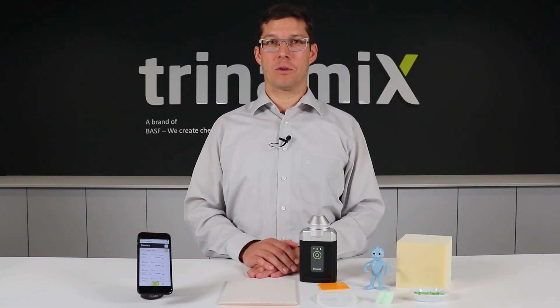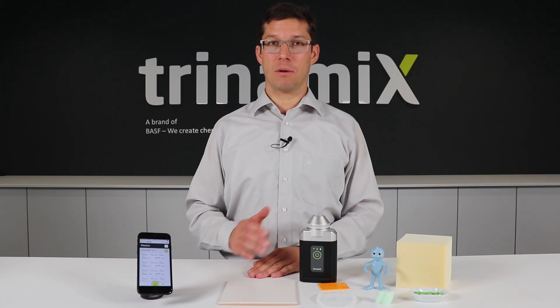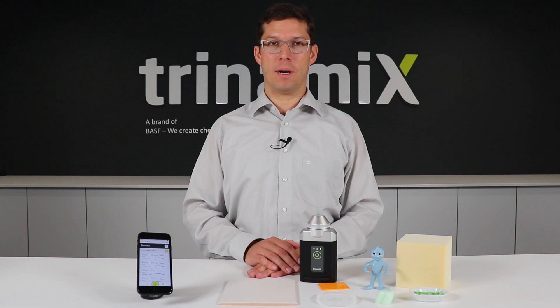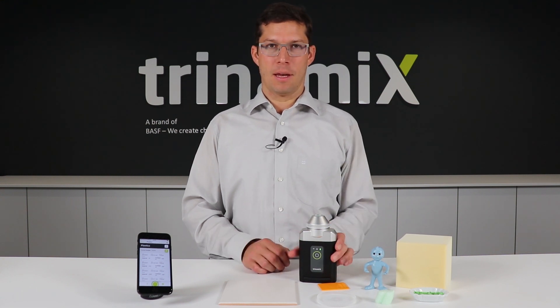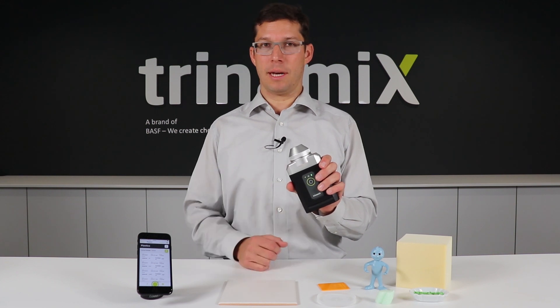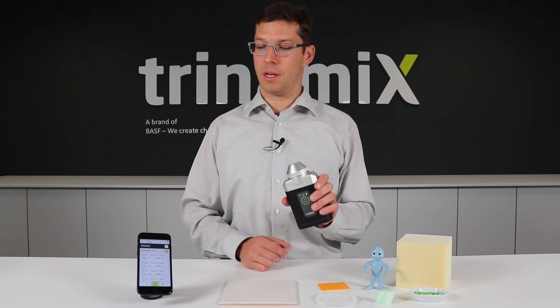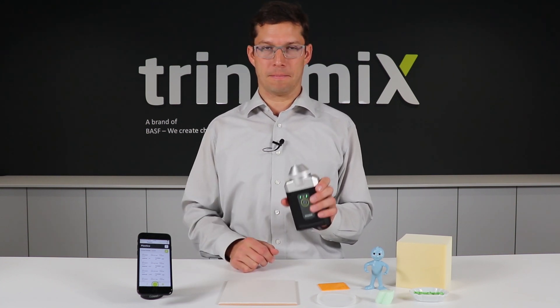Hi and welcome to Trinamix. This is our introduction to our mobile plastics identification. This is our handheld device, the mobile NIR spectrometer, which is already connected to the smartphone app.